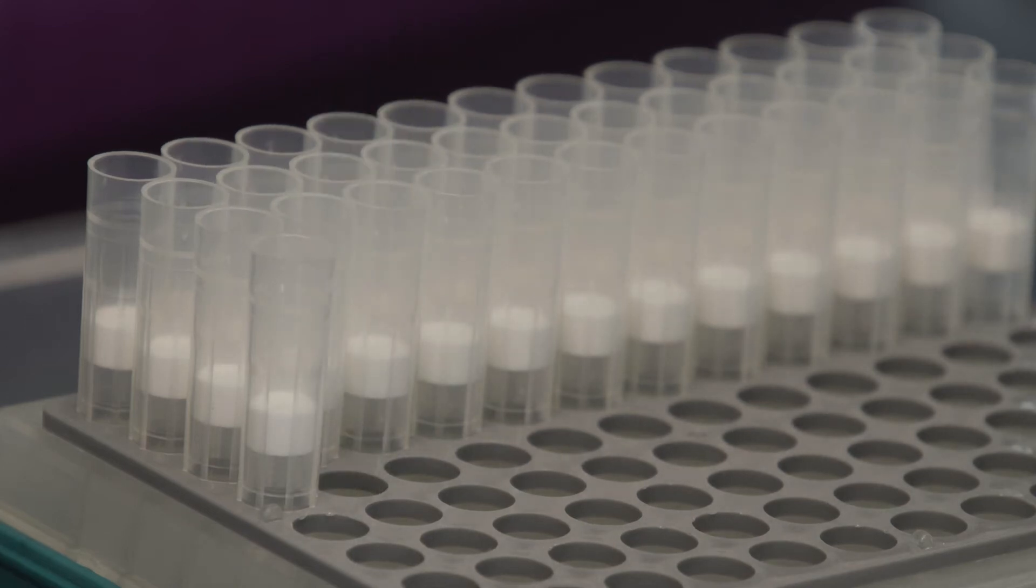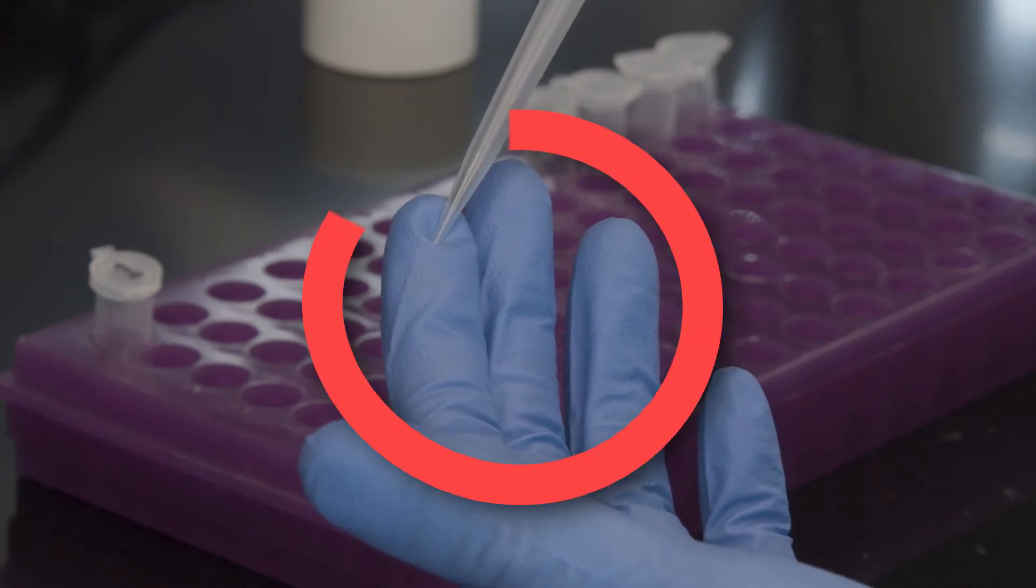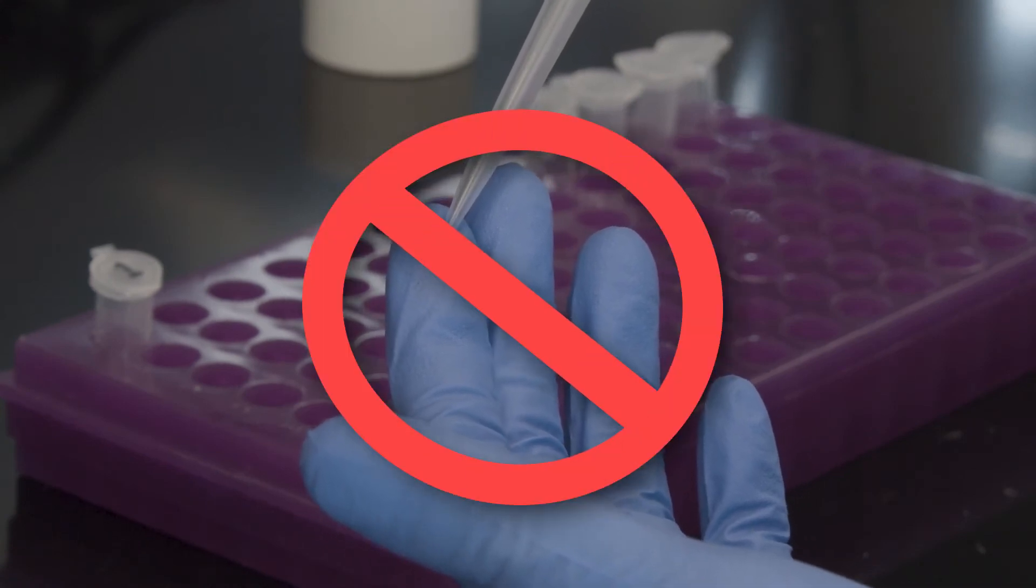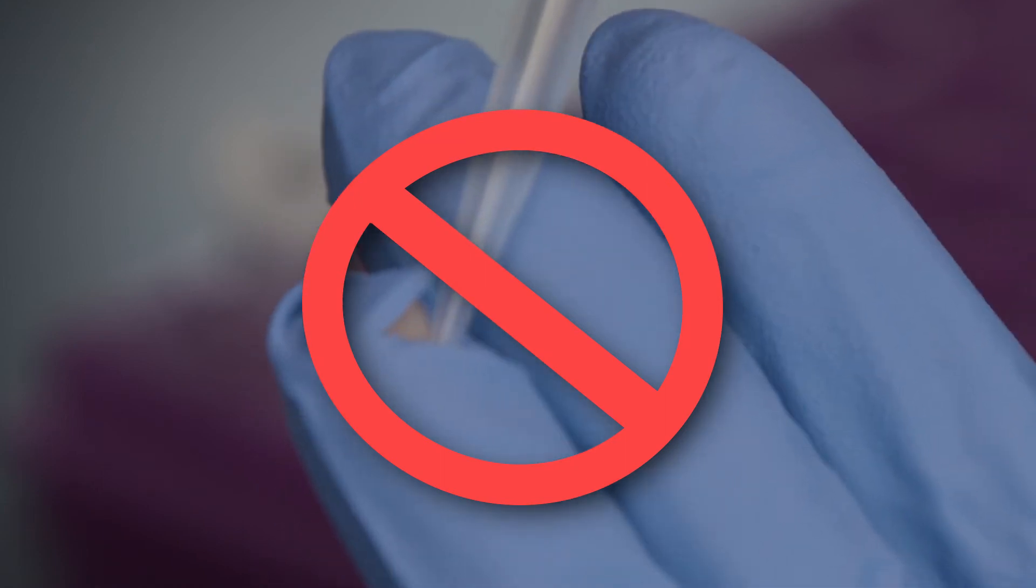Before you move on, ensure the tip is properly set in the pipette. Do not touch the tips with your fingers. Doing so could contaminate the tips or puncture the tip of your glove.